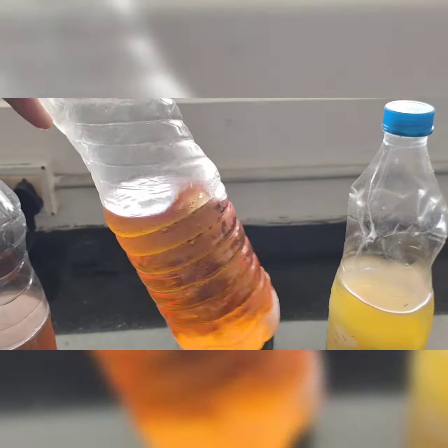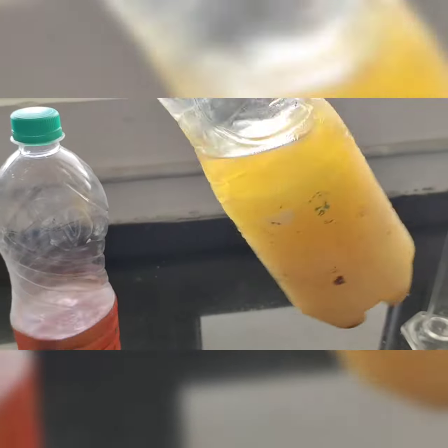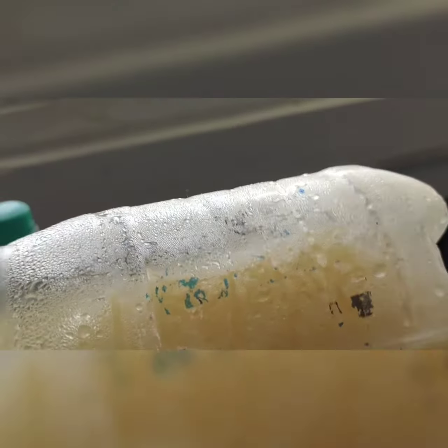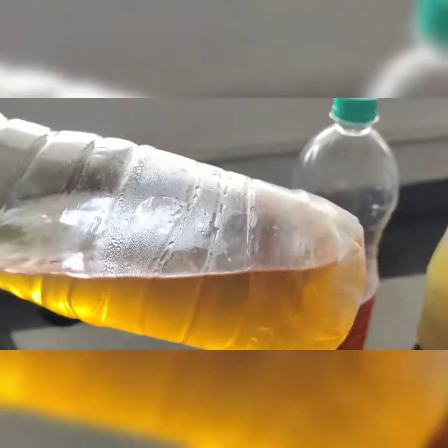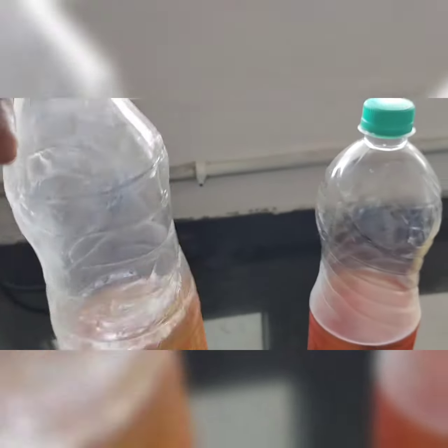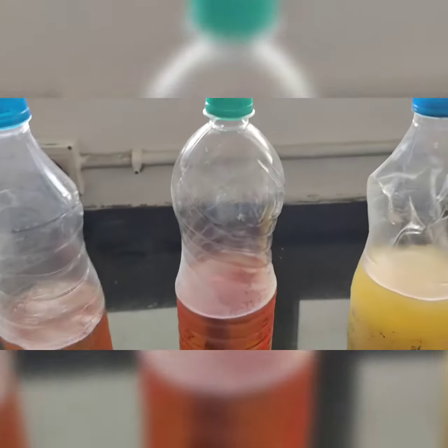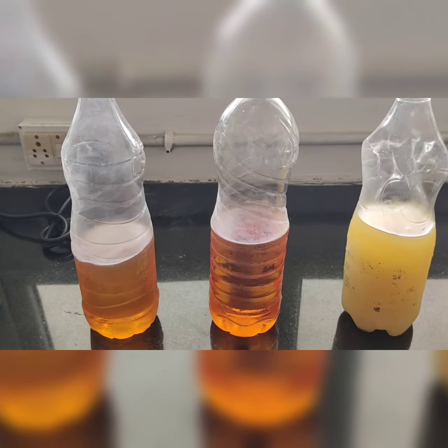So this would probably be the petrol, and this one is light in color and it is frozen. You can see at the bottom, as I kept it in the refrigerator, it is frozen. And this one would be the diesel. And this third one, slightly at the bottom I can see some freezing, that means it is frozen, and at the top there is petrol, so it is semi in nature. So by seeing the nature and consistency of the fuels, we can identify which one is what.